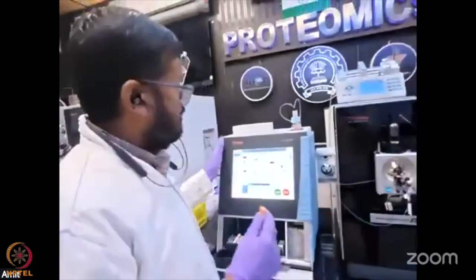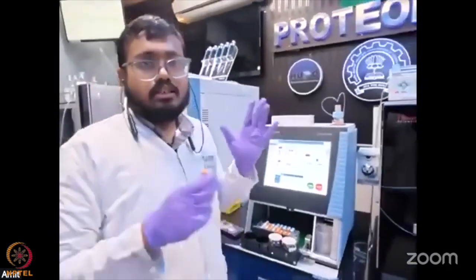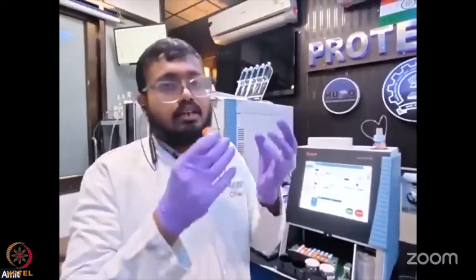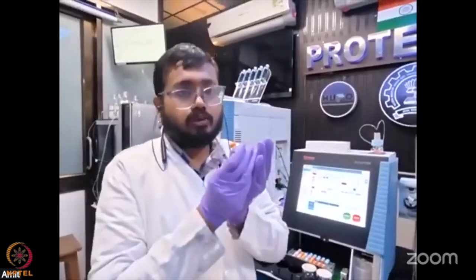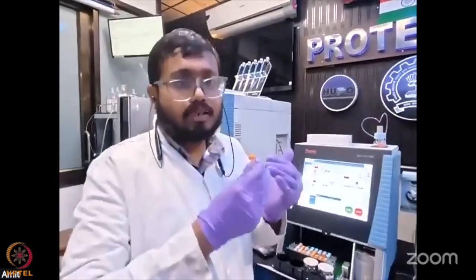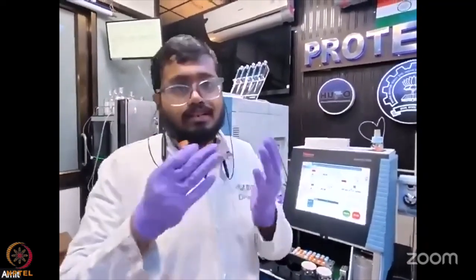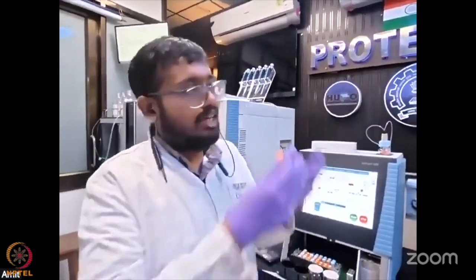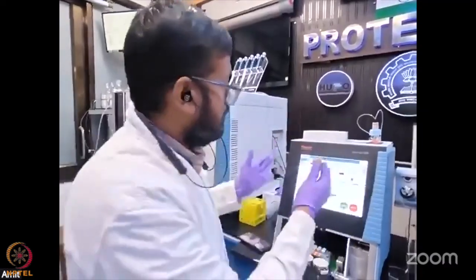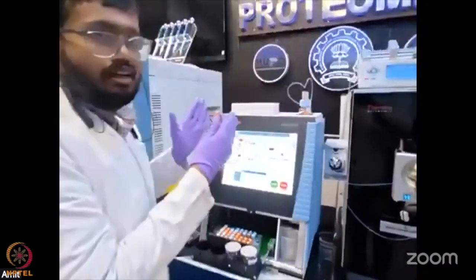So LC here is nano LC, or nano liquid chromatography. You know that the complex samples, like from a tissue or cells, contain a complex mixture of proteins, which we are digesting into peptides. Now we want to see what peptides are present and quantify them, right? This cannot be achieved if we inject all the peptides in one go, because the detector and the mass spectrometer will get oversaturated. That's why we need peptide separation, which we do using reverse phase chromatography. For this instrument, we use nano LC.